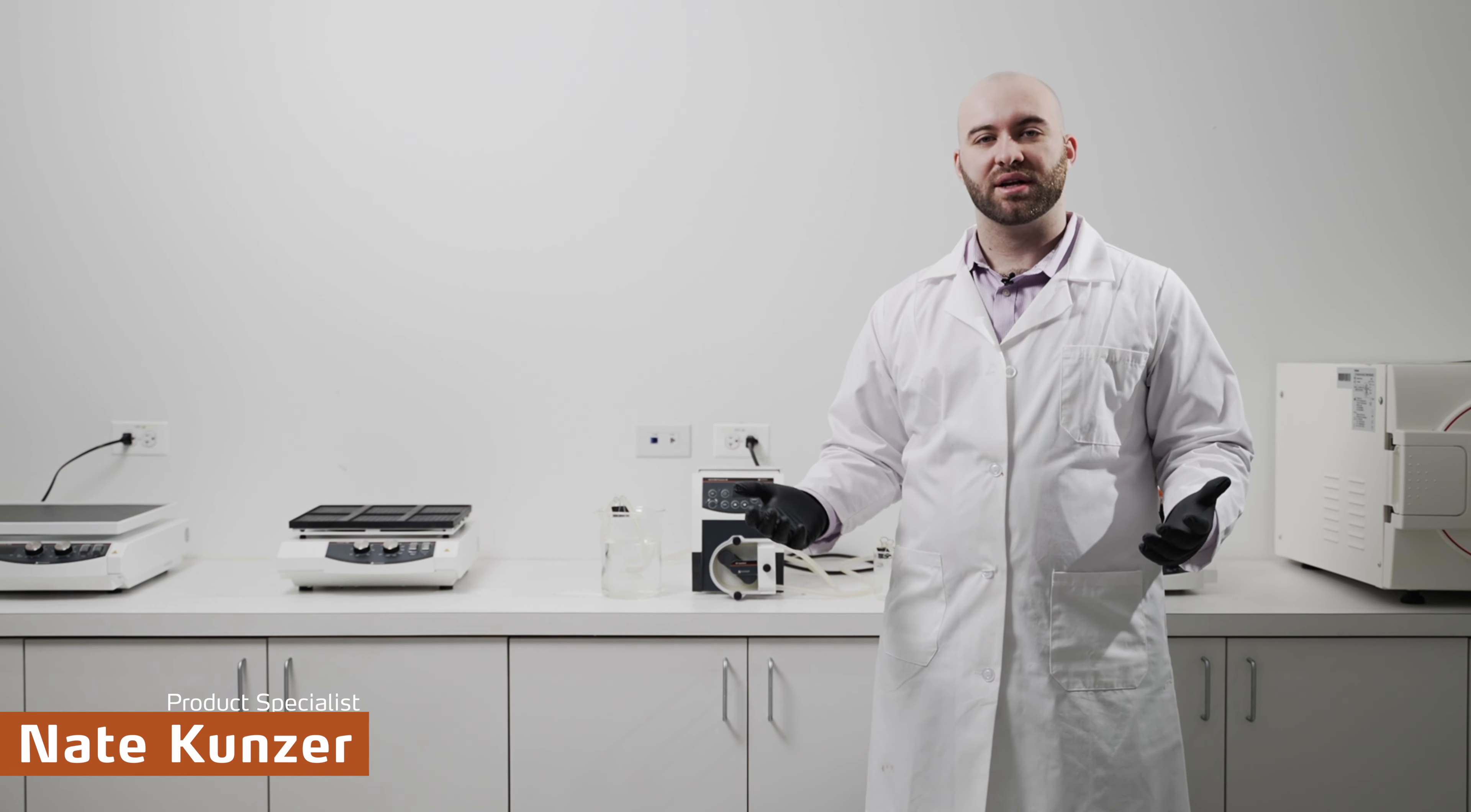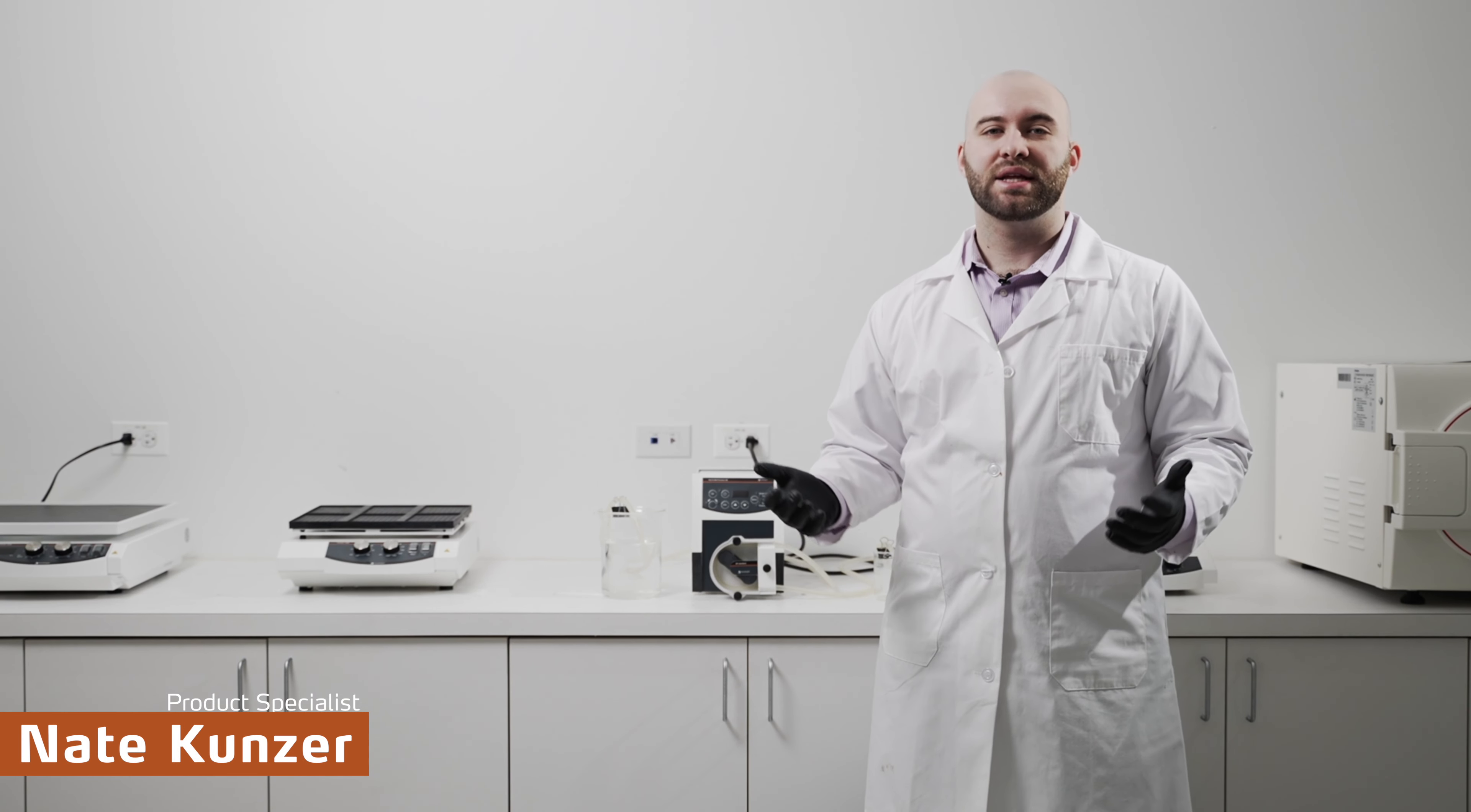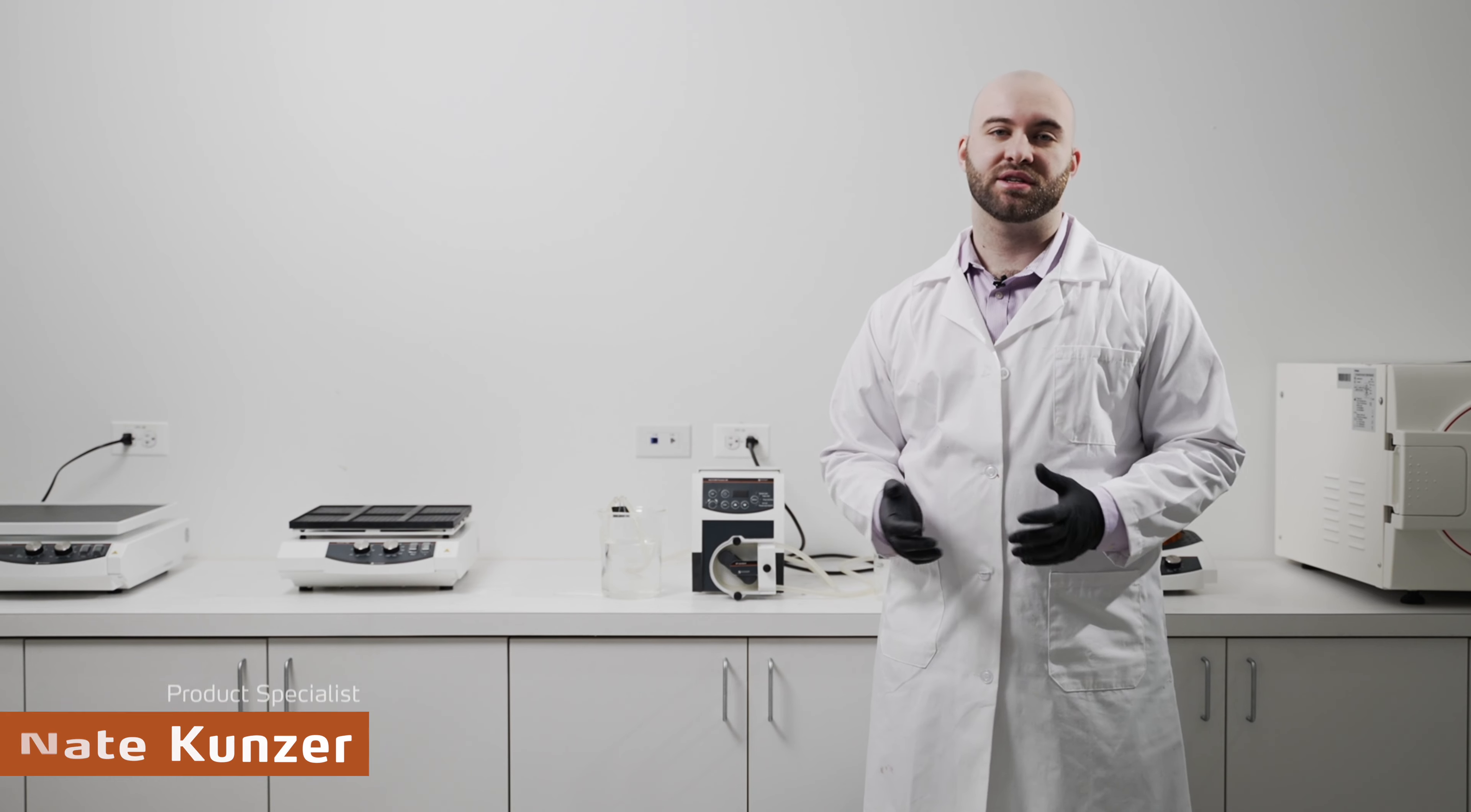Hello, I'm Nate Kunzer, product specialist from Heidolph North America, and today I'm going to show you how to calibrate your peristaltic pump.